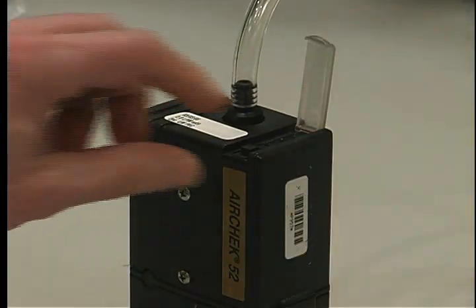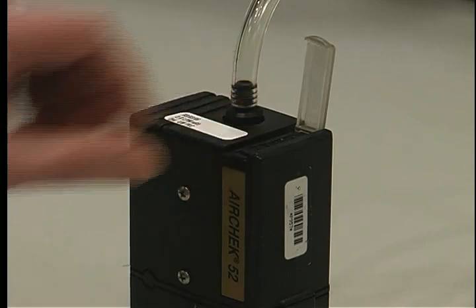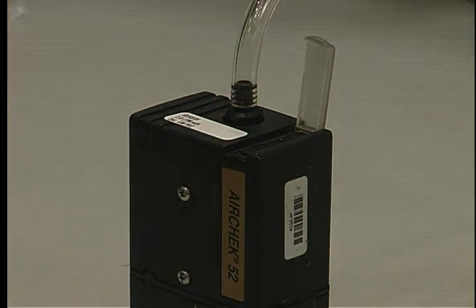Start the pumps so they can be warming up. They need to run at least three minutes before you begin the calibration.